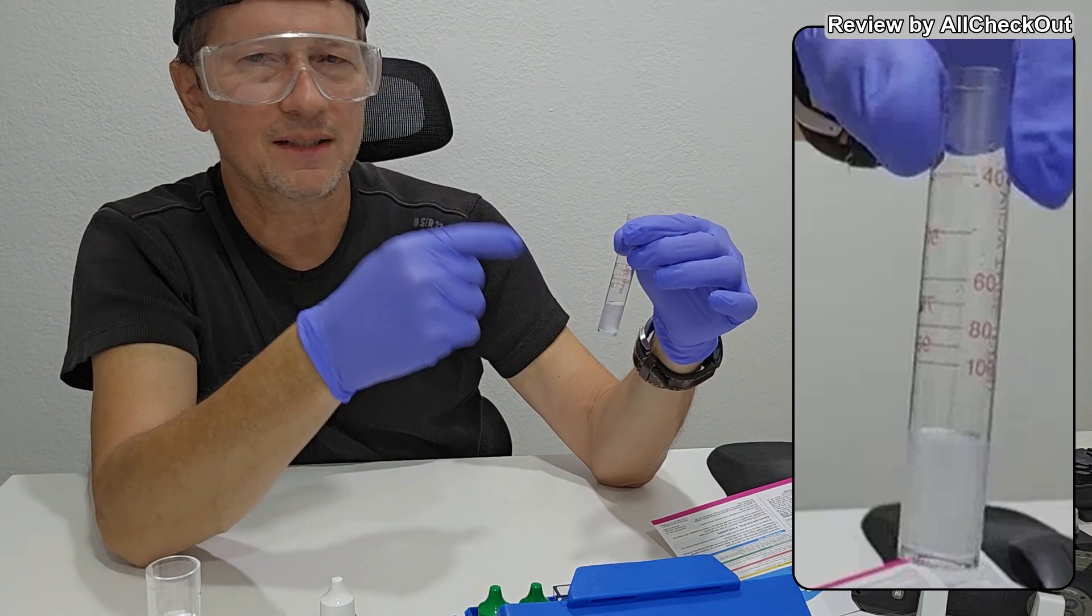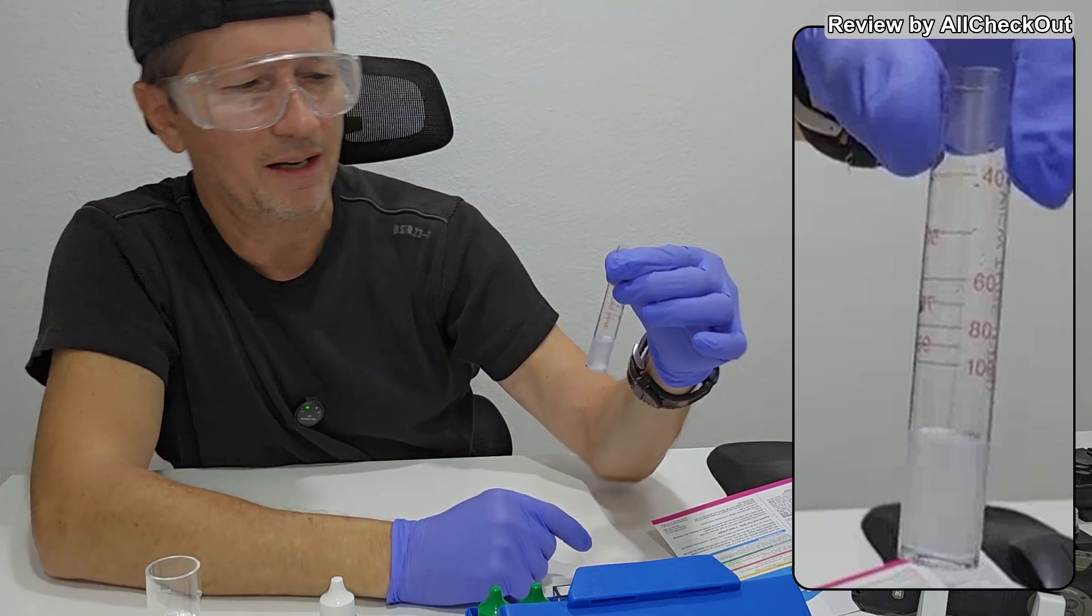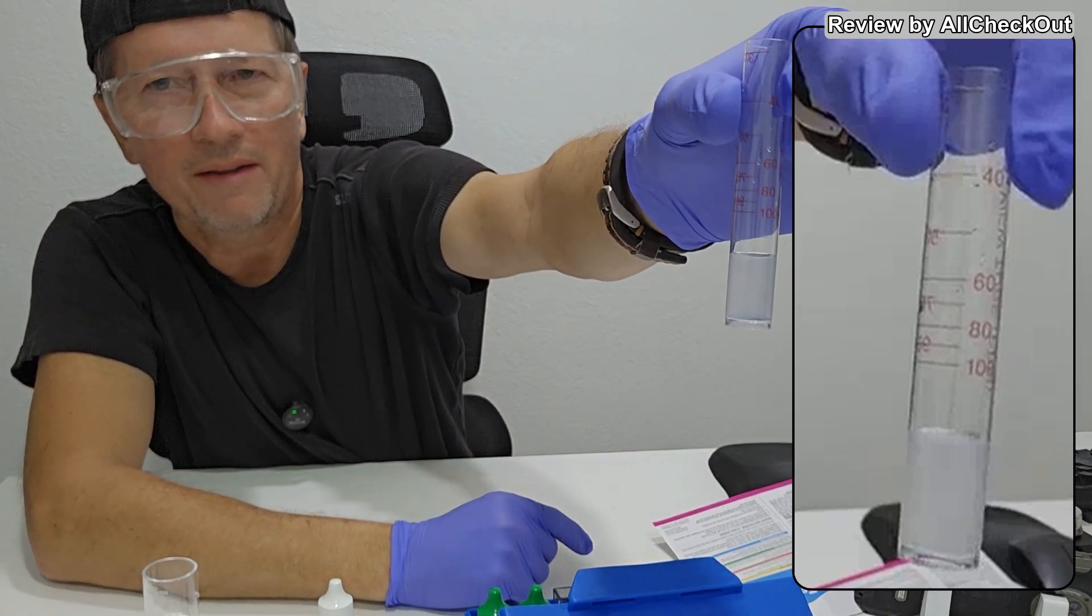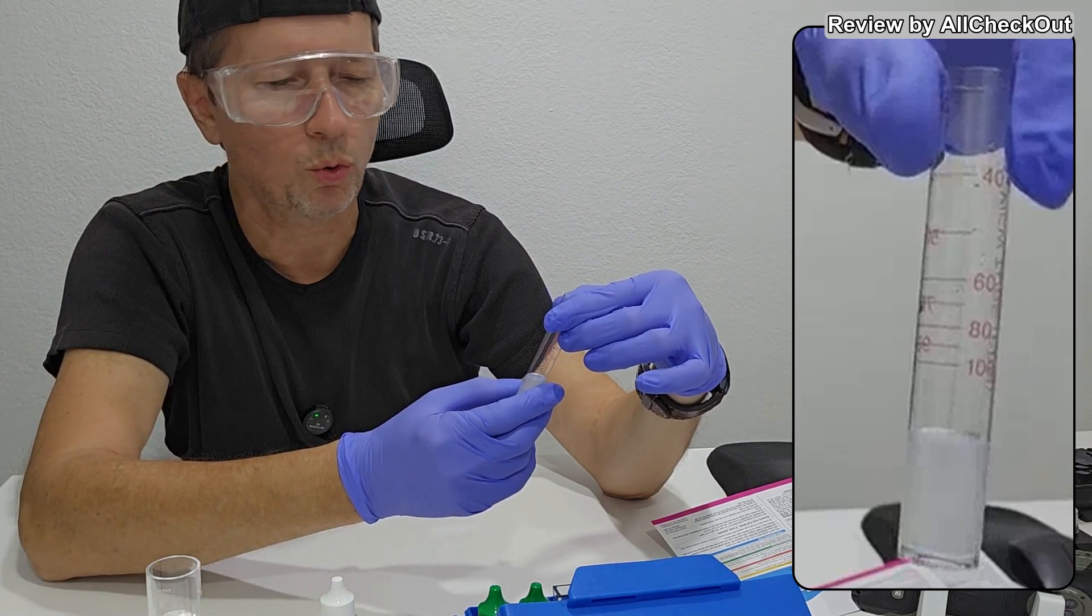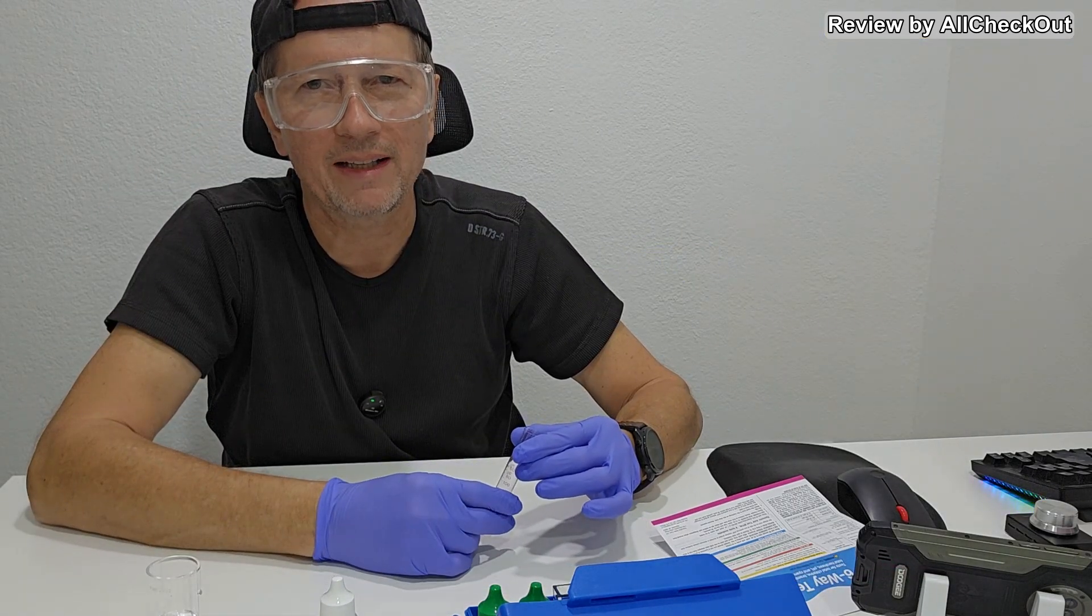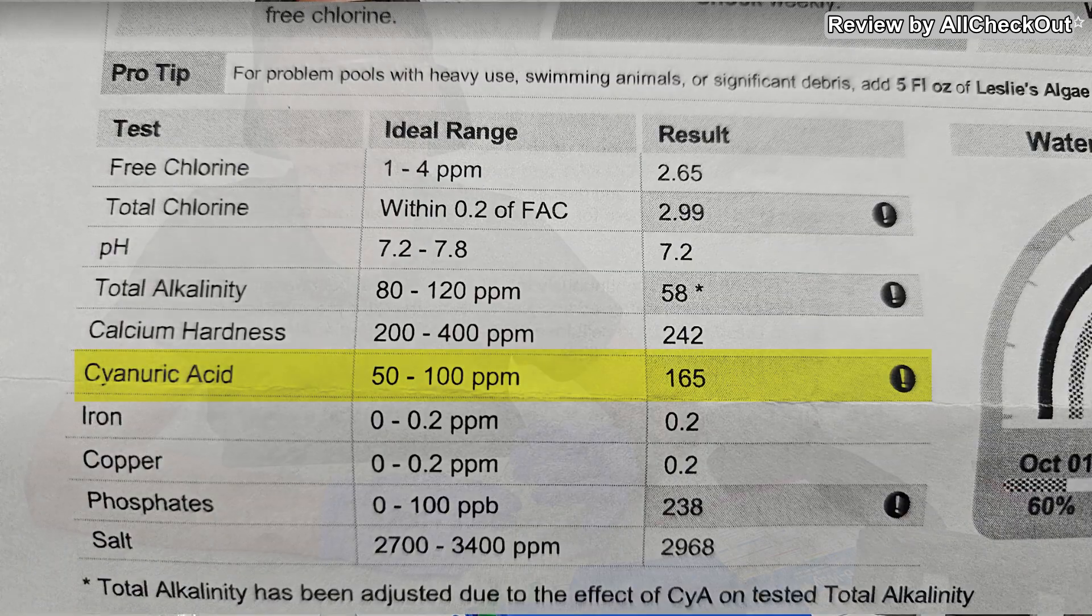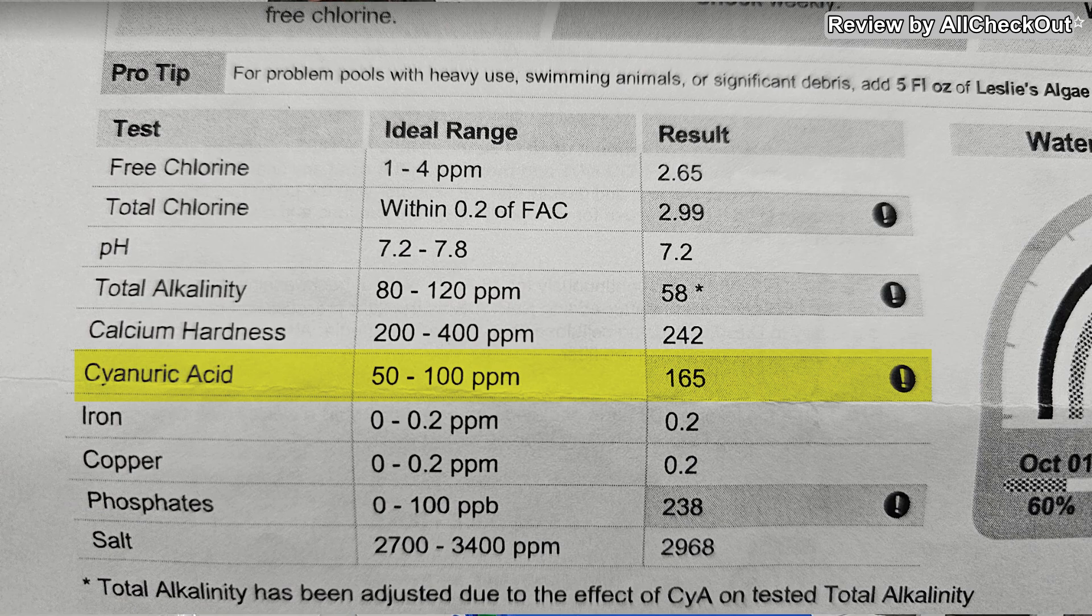Because the level is not increasing to the top - the cyanuric acid numbers are actually increasing down there. And when they are so low we definitely have way too much cyanuric acid in the water or pool water which I have here. I've been testing the pool water at Leslie's Pool Supply and the reading showed around 160, which is way too high.